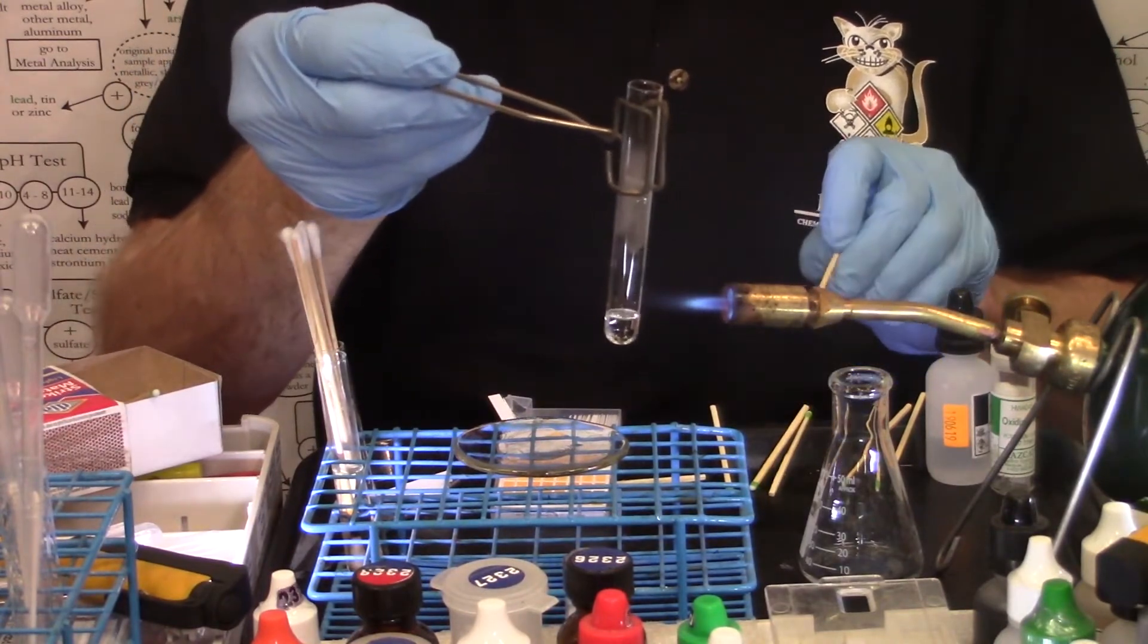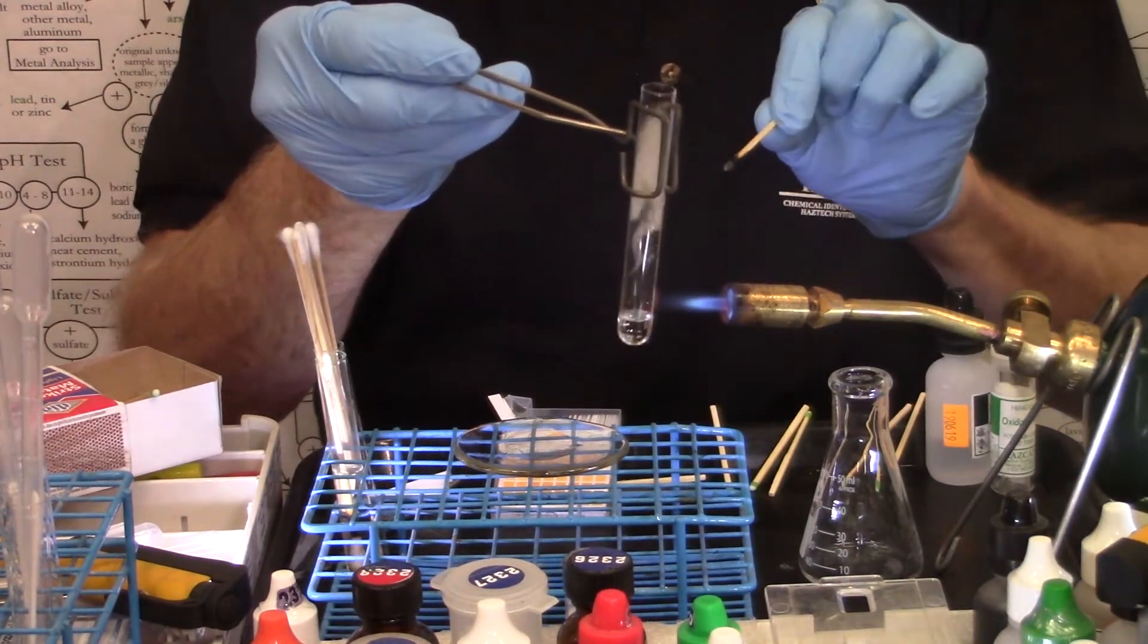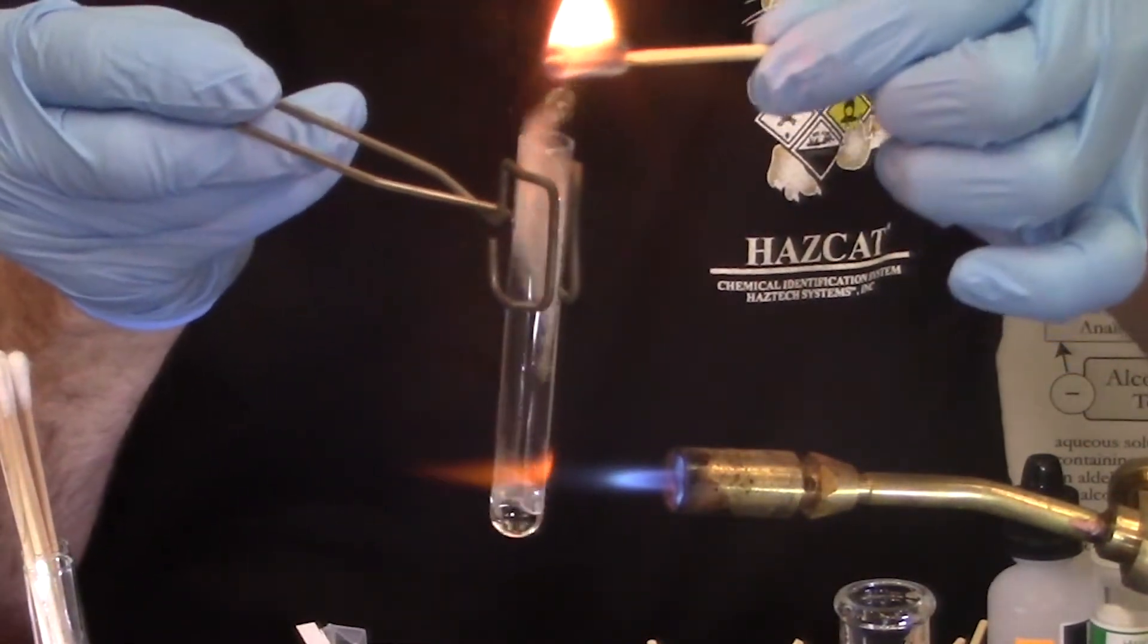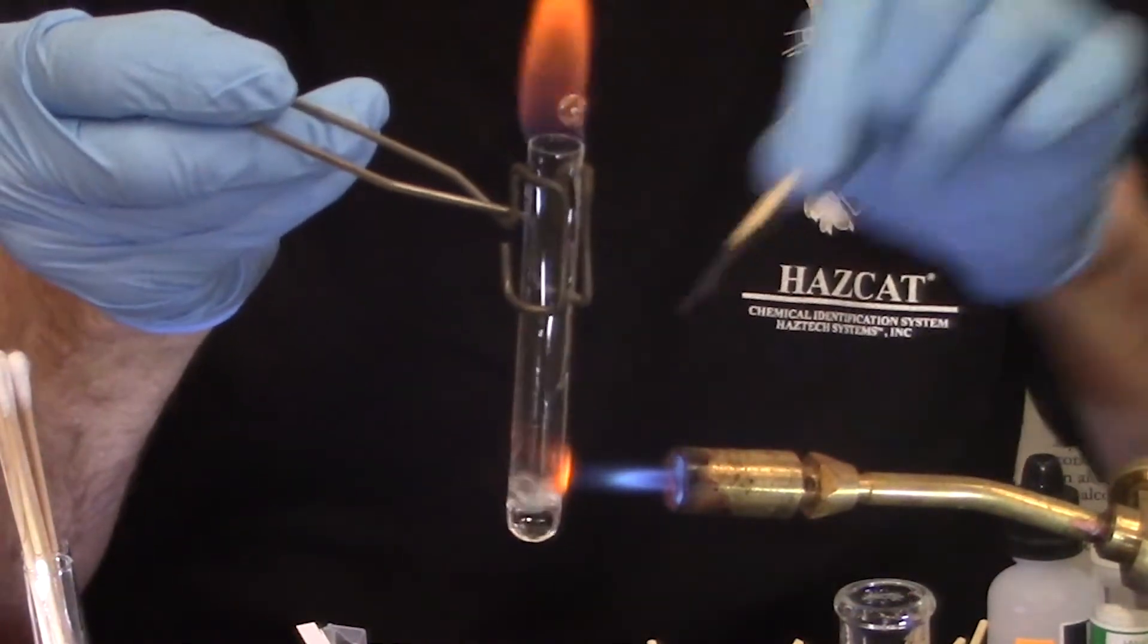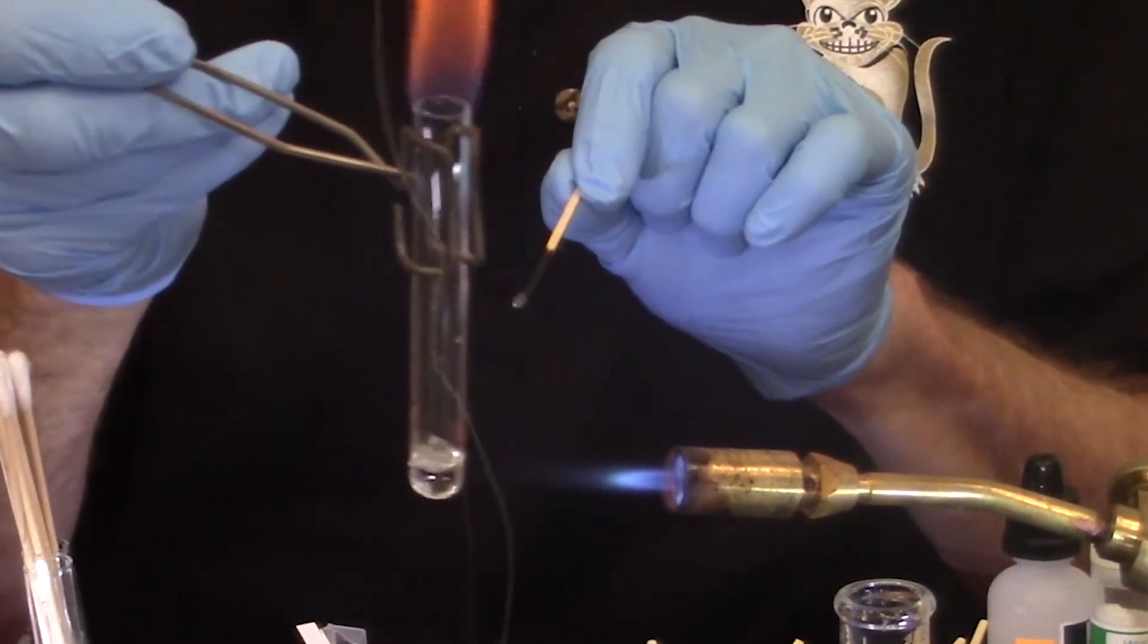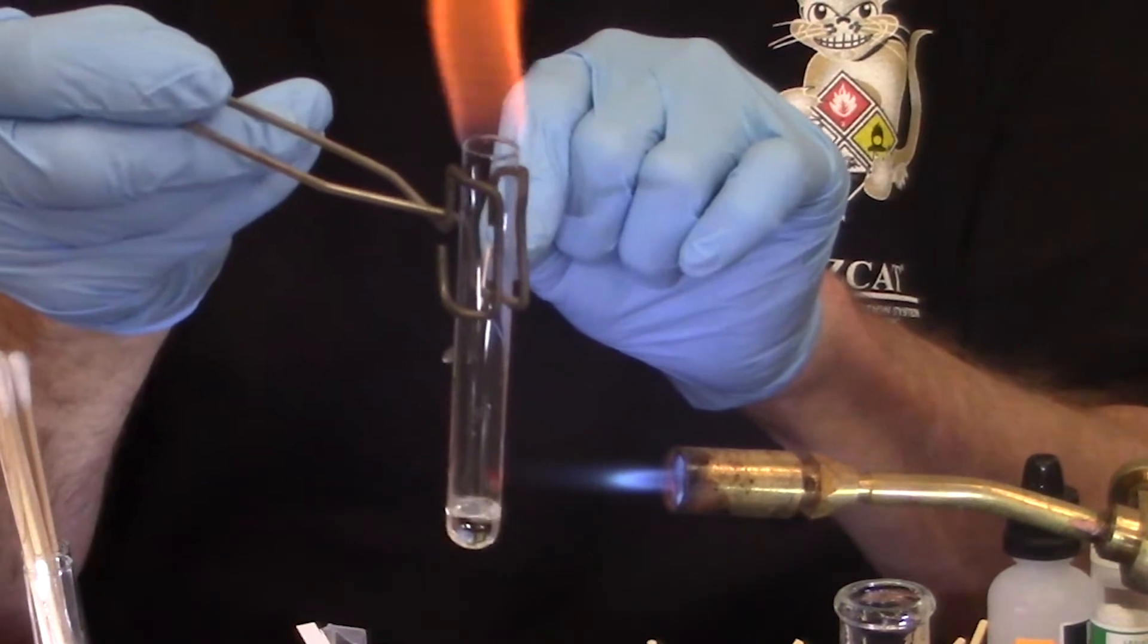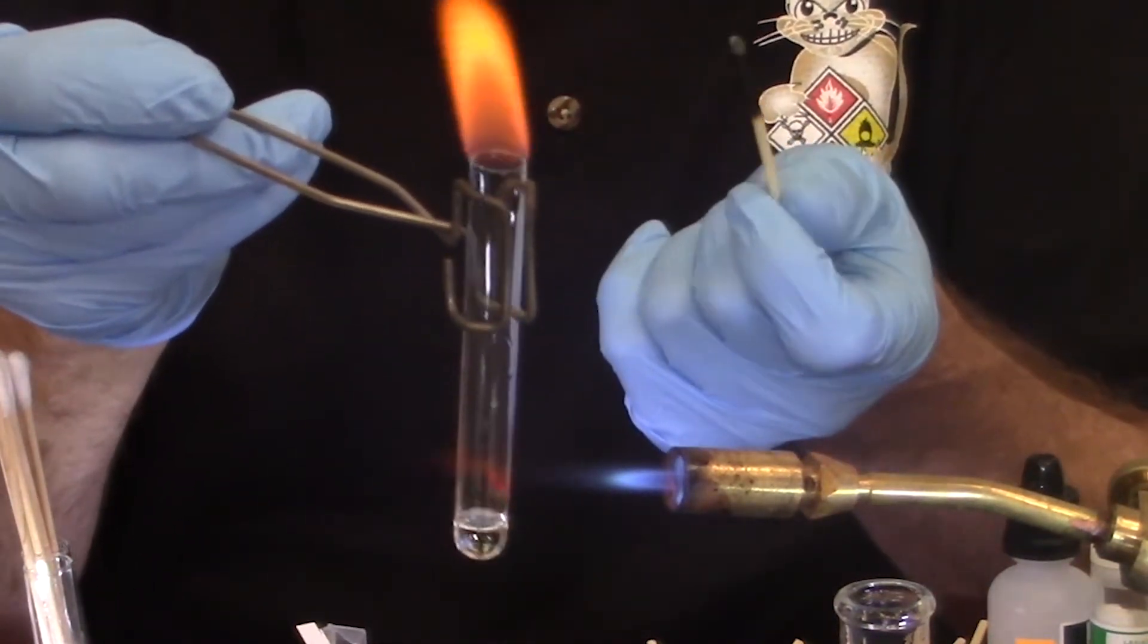Now you go into the hottest part of the flame. And for a liquid, once again, I heat the test tube from just above the surface of the liquid. I'm going to take a match and keep it over the headspace vapors that are coming from the liquid, let's see if I can get them to light. I was able to easily get them to light this time. This is what we call a positive thermal ignition.